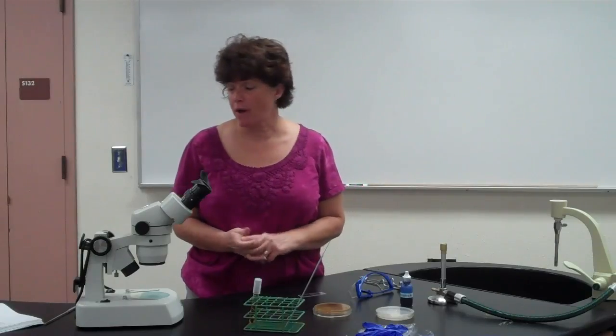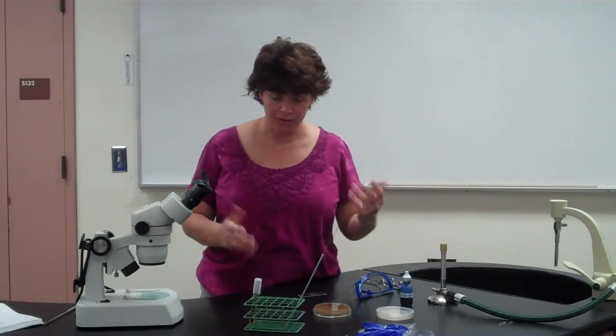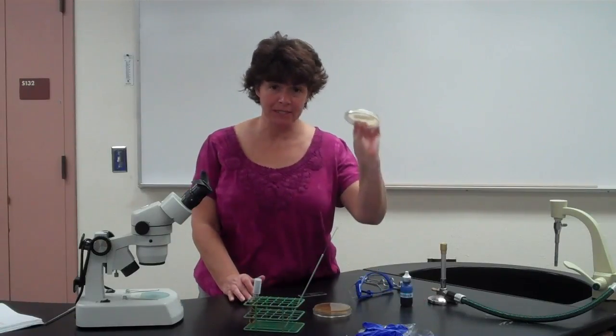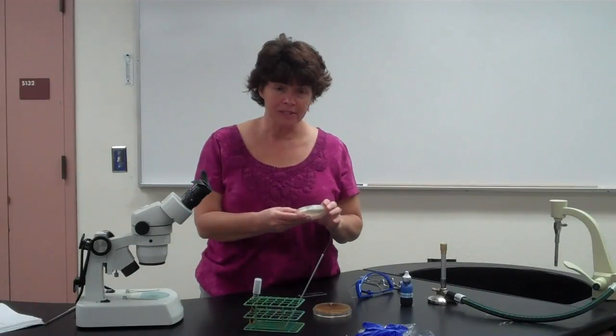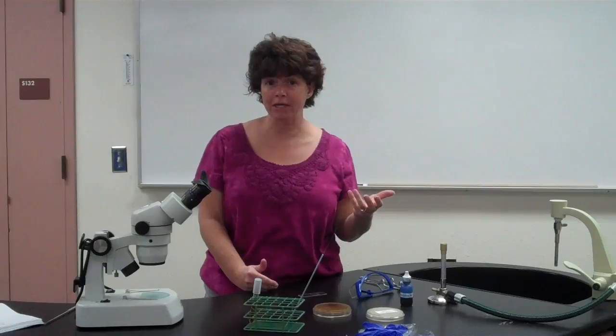Your lab manual has about 9, but we're only going to use 6 of them because that's all that we have. So hopefully you'll have a plate of the particular microbe. Now this time they're actually going to be numbered instead of named. So the idea of this lab is that you're going to have to identify what it is based on their characteristics.